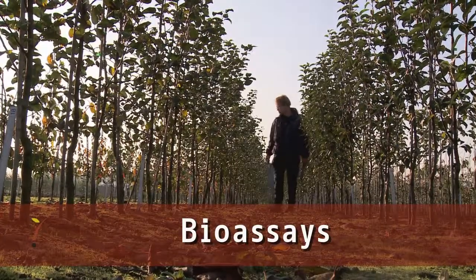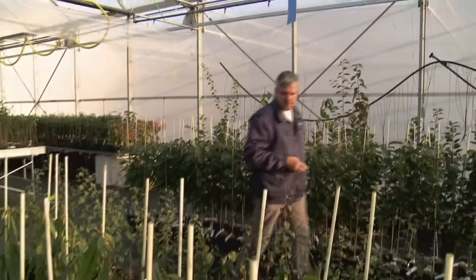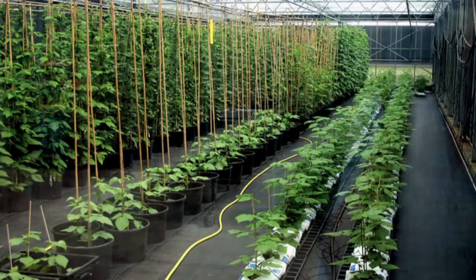Bioassays are used in the detection of alive, unknown pathogens. The main difference with other tests applied by Naktuinbouw is that bioassays are conducted on plants. Tests are therefore carried out in the field or in a greenhouse and not in a laboratory.